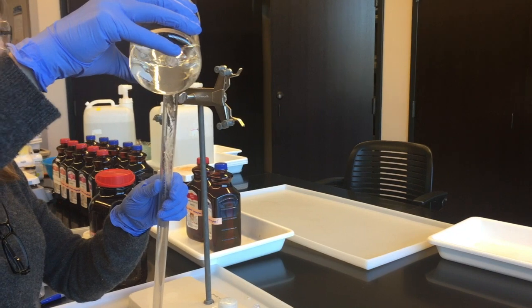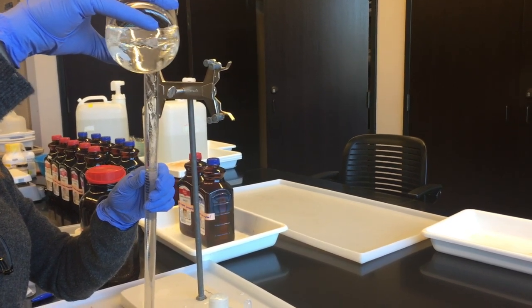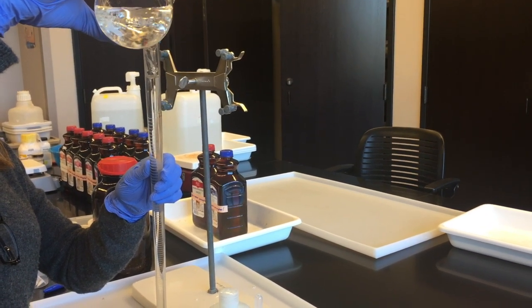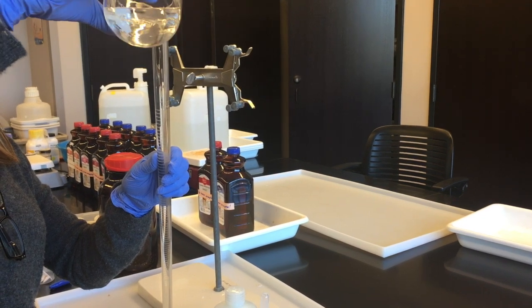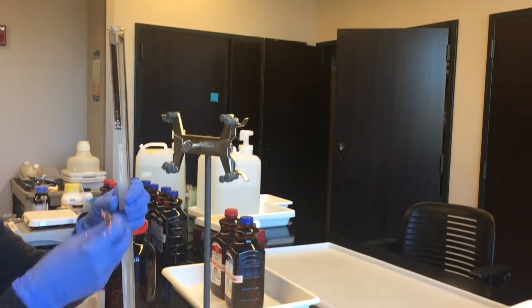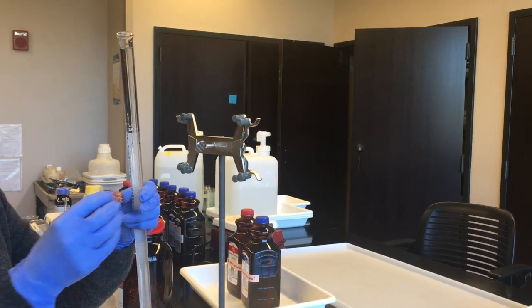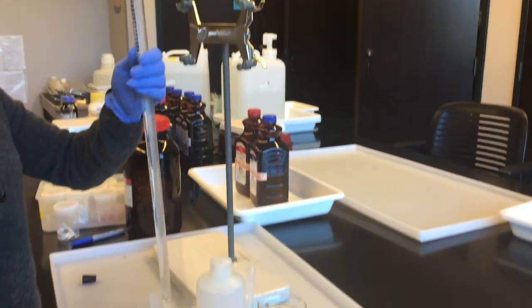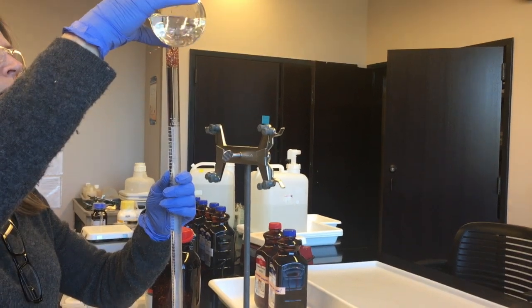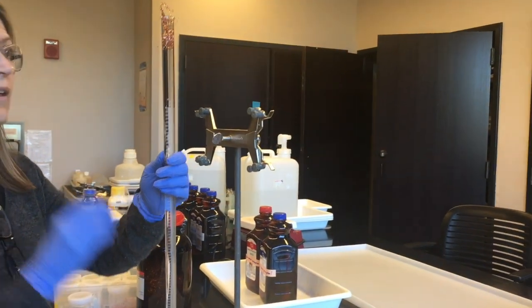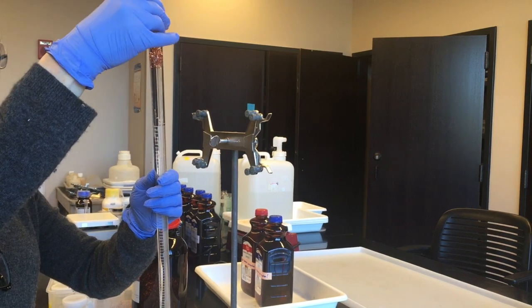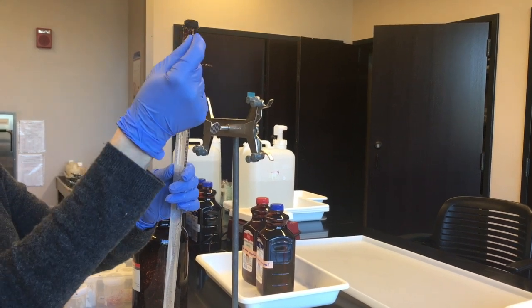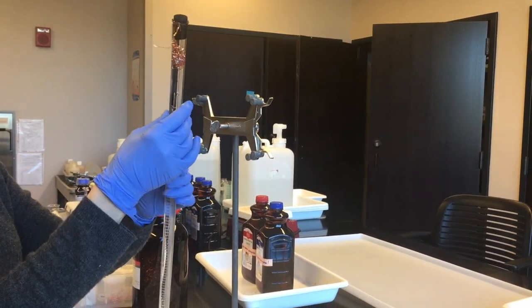And you're going to fill the entire tube up to the top so that you can put your magnesium that's wrapped in the copper into the tube and then put the one-hole stopper on the top. Make sure that there's some of the copper sticking out the top. So that that's the tail holding it in.